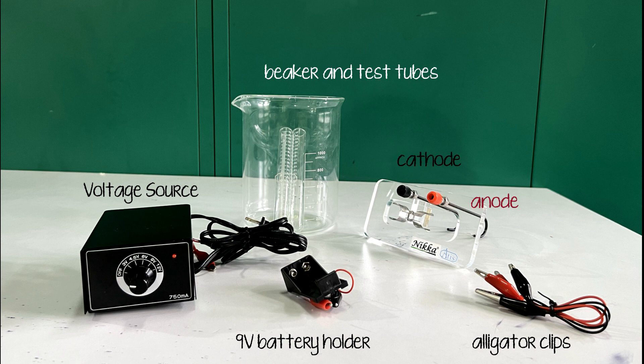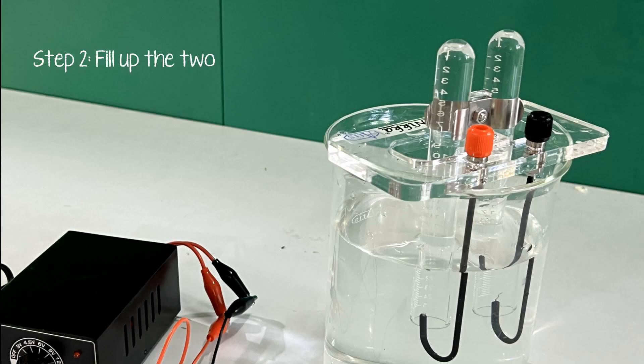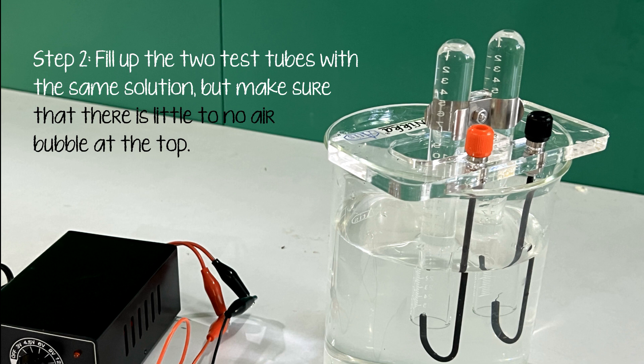To start with, let us fill about two-thirds of the beaker with our salt solution. Then, fill up the two test tubes with the same solution, but make sure that there is little to no air bubble at the top.